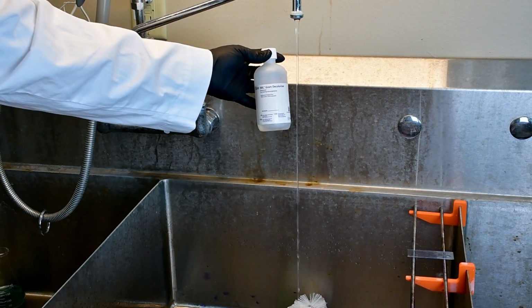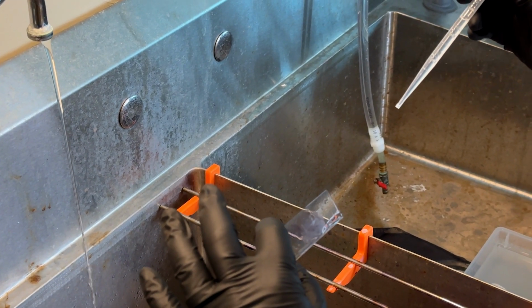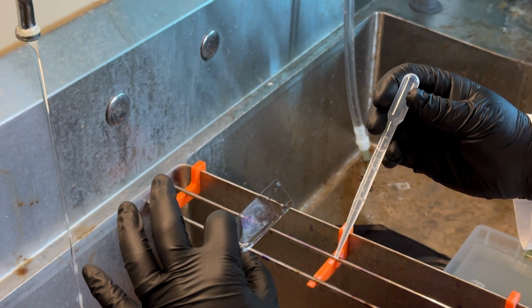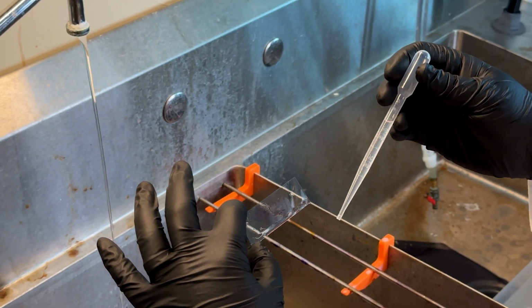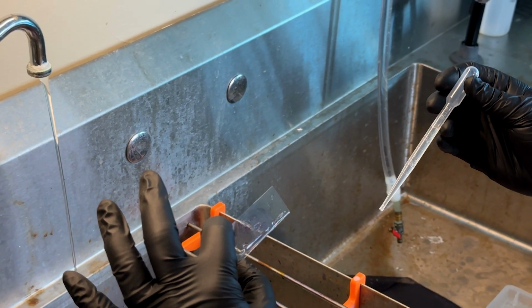I'm going to use gram decolorizer. And this is a kit that you can generally buy just about anywhere online. It'll just be the standard gram stain kit. Now, I'm going to be very careful here. Now, when I'm adding this gram decolorizer, I'm going to place it on the top of my slide. I'm going to let that decolorizer run down, and I'm watching my slide, and I'm watching the streaks of purple come off. Now, as soon as I start to see my stain no longer hanging onto purple, that's my cue that my decolorizing is done, and I need to rinse it very quickly. I can over-decolorize the stain, and that'll result in everything looking red, even if it's not supposed to.